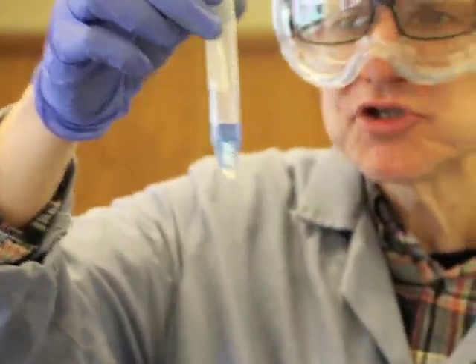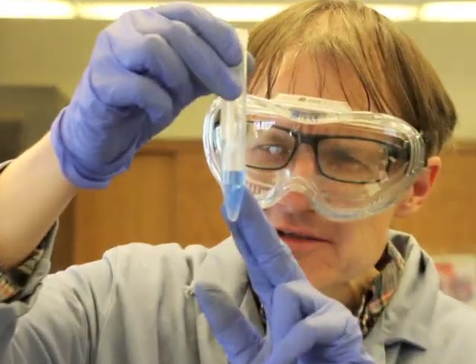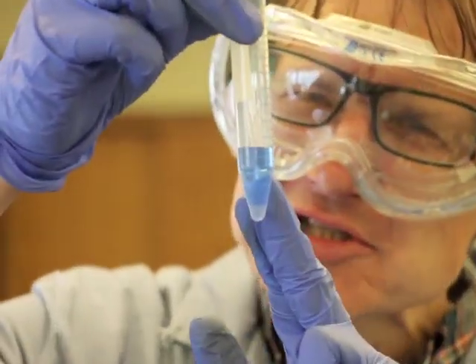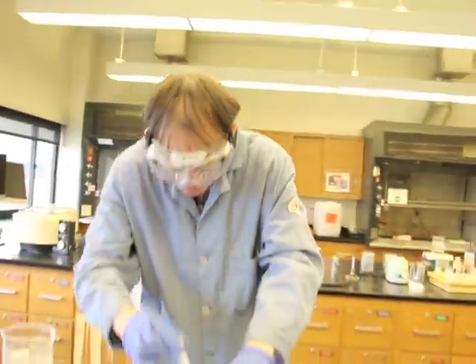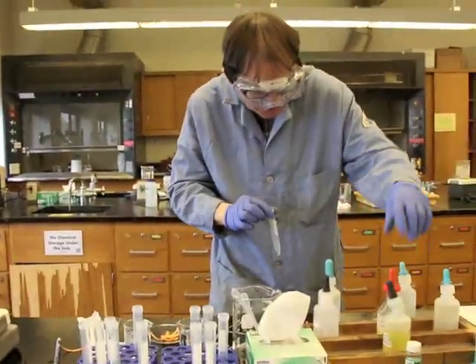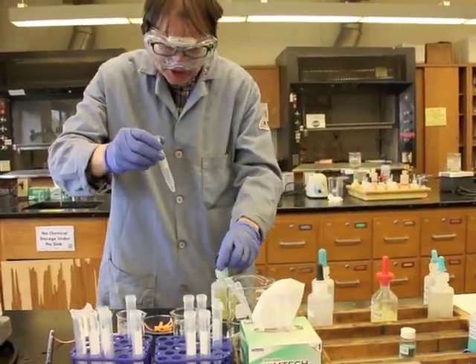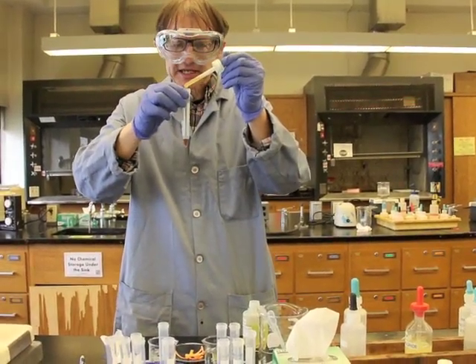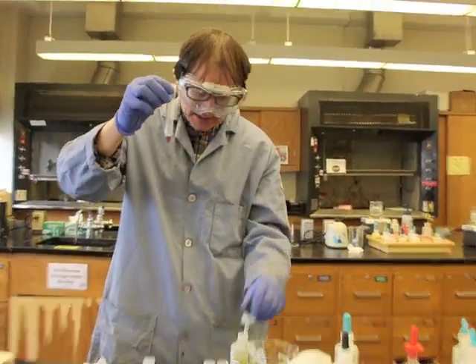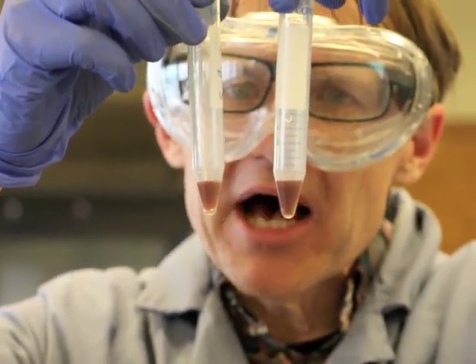It's really, the copper 2 ion in ammonia is very beautiful. That blue test really gives us the answer. That tells us that there's definitely copper 2 in our unknown. We actually know that already, but now we could do one more test, which is to add the potassium ferrocyanide, and let's see what happens here. Again, we're expecting a red precipitate. Oh, 1 drop immediately there, right? Here's the known, here's the unknown. 1 drop of the potassium ferrocyanide gave us the positive result.